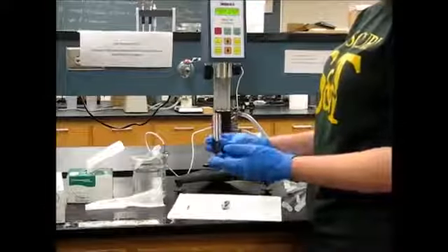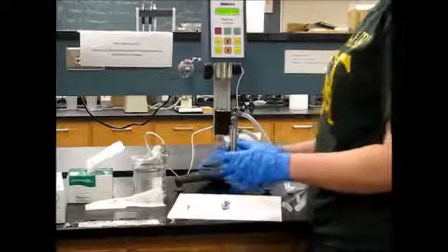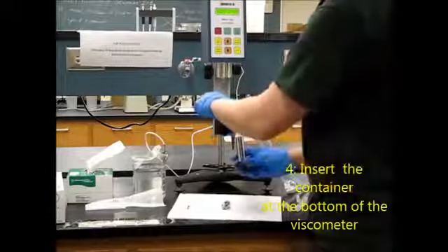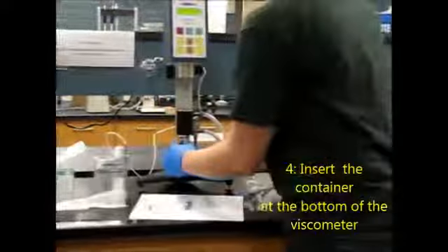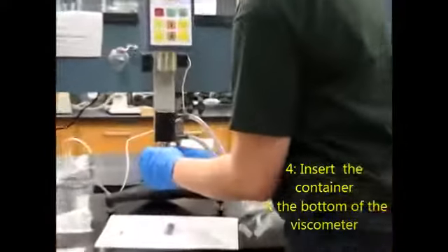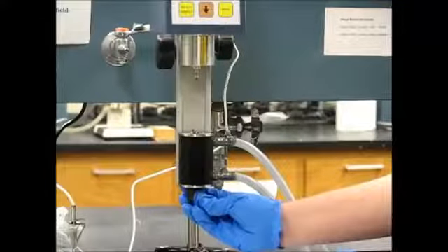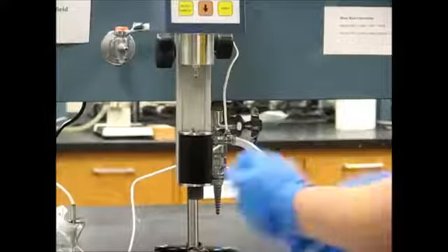Now that our sample container is around 25% full, we're going to go ahead and attach it. There's a little groove which you want to match up with the inside of this container. So we're going to place it below, push it up until the grooves match together, and then lock it in place. Now our sample container won't go anywhere.